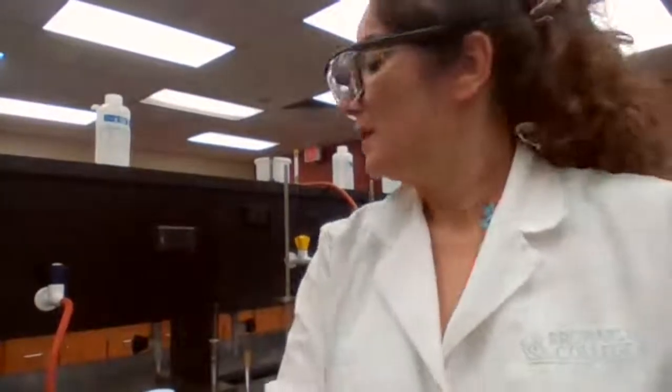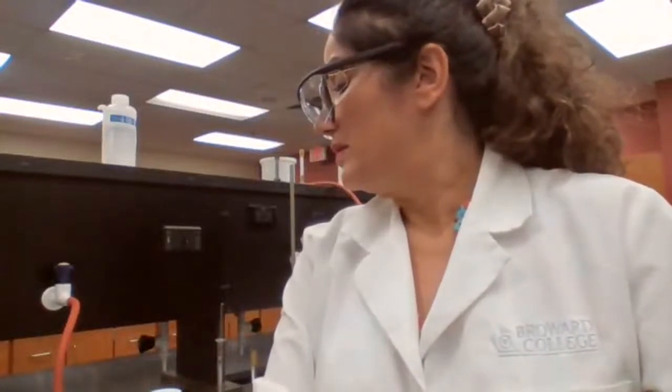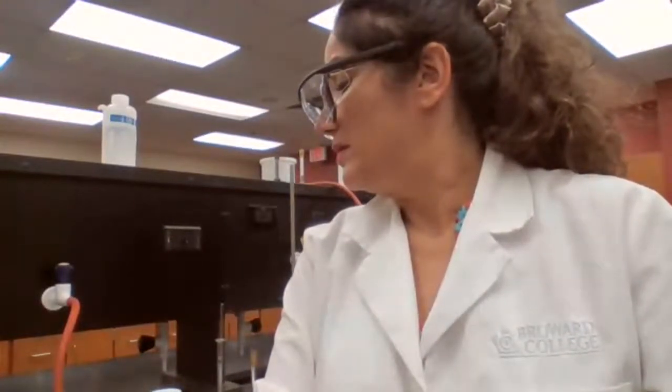So part 2B. And the mass is 46.508. That is in grams.